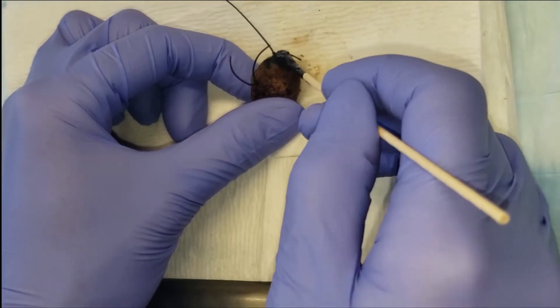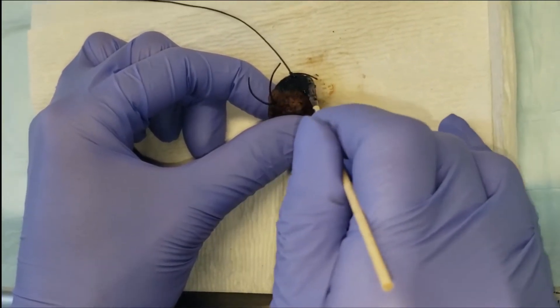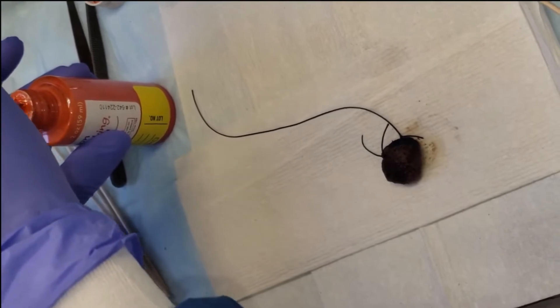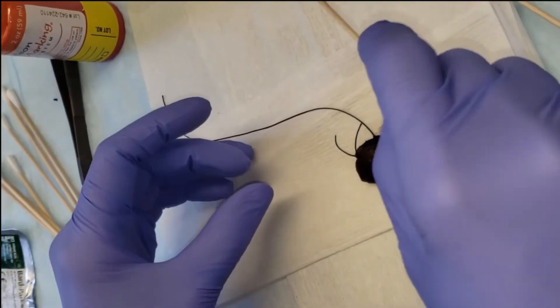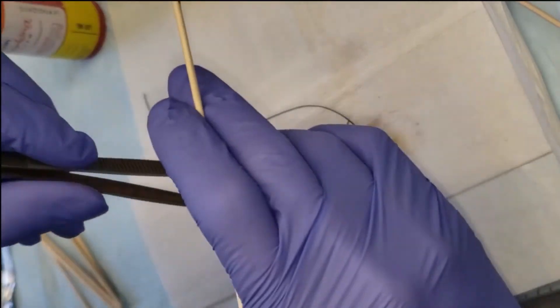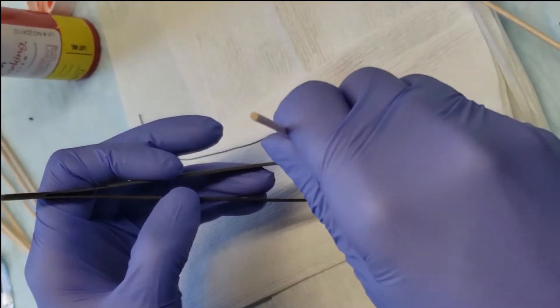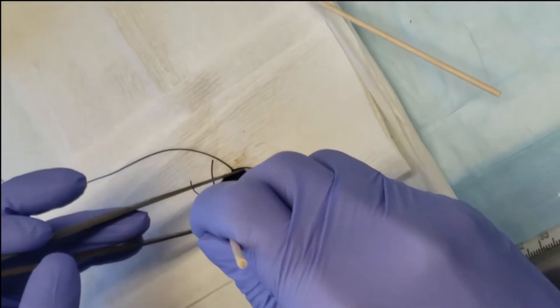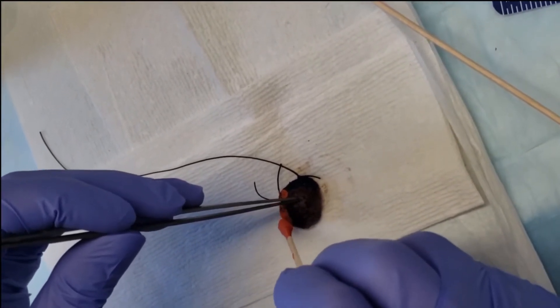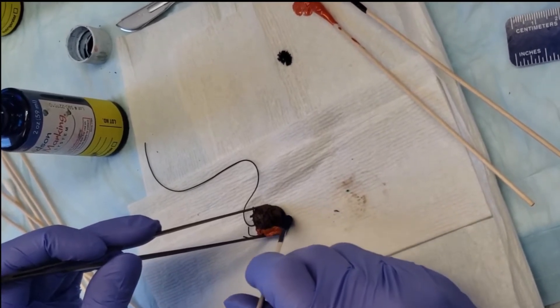So we use different colored inks to label the different sides. Here you can see that we're applying green ink to the area of the long suture, which represents anterior. We apply a different colored ink to different sides and this ink will show up under the microscope — that way if we see the colored ink when looking at the slide we know we truly have the end of the surface. If the slide gets cut at an off angle or tangentially we may not see the ink and therefore it's not the true specimen margin. Here we have blue going on opposite to the long suture, so this is the posterior specimen.